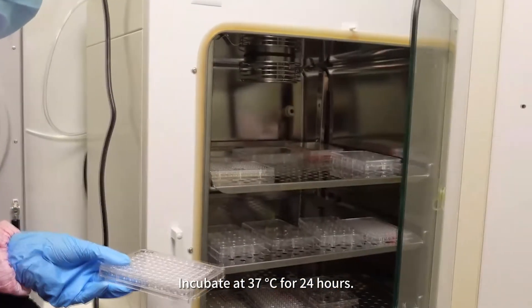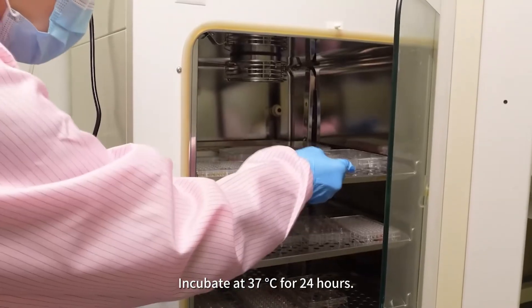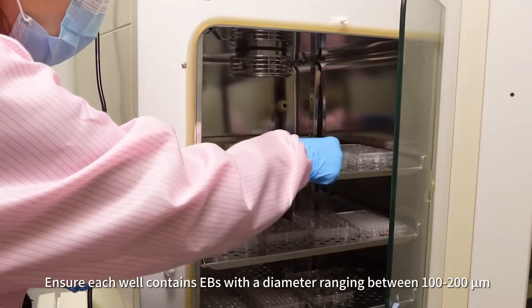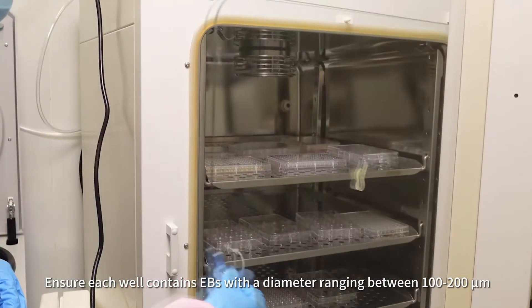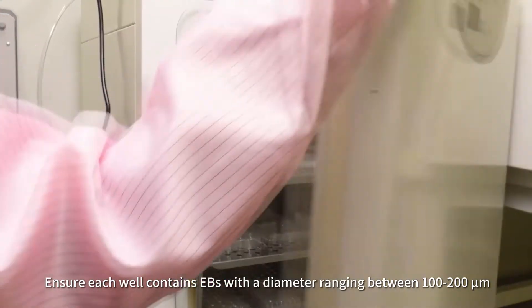Incubate at 37 degrees Celsius for 24 hours. Ensure each well contains EBs with a diameter ranging between 100 to 200 microns.